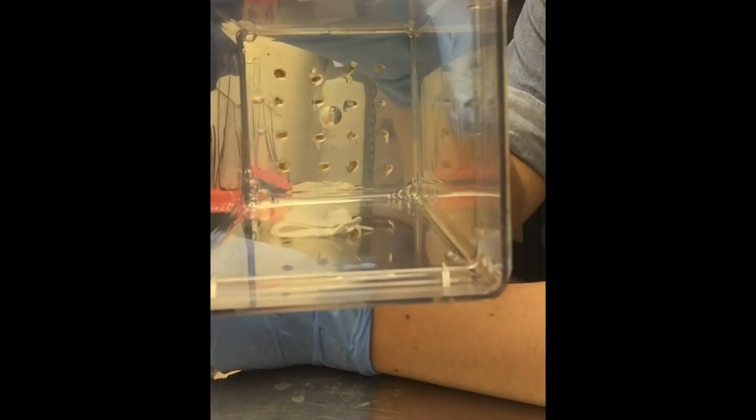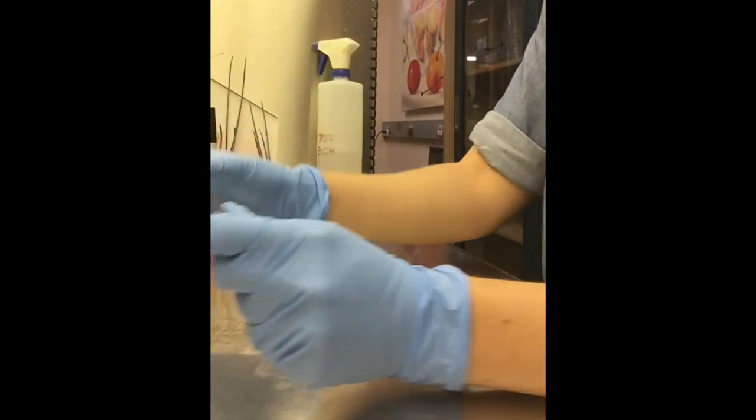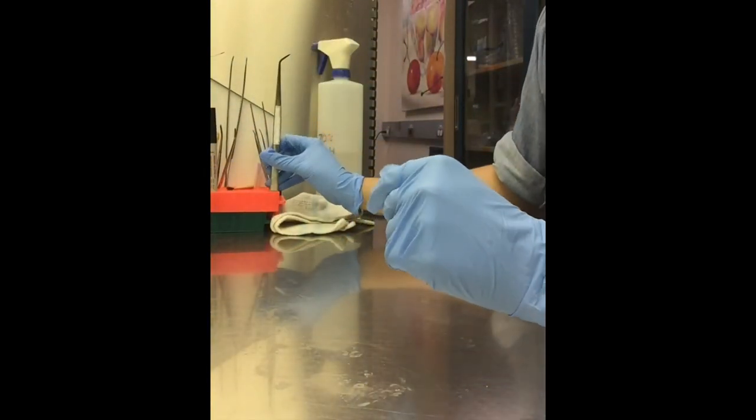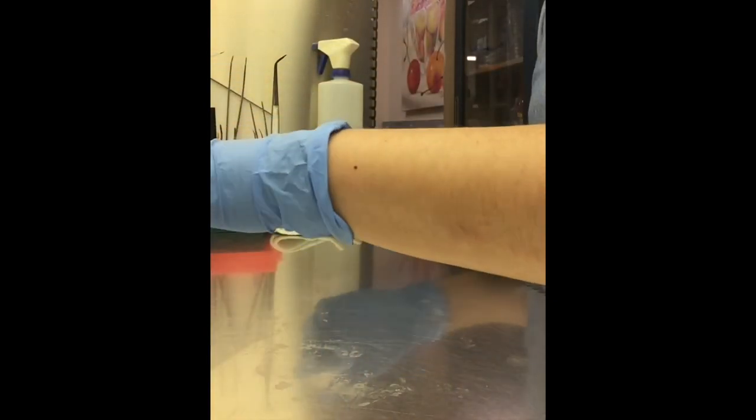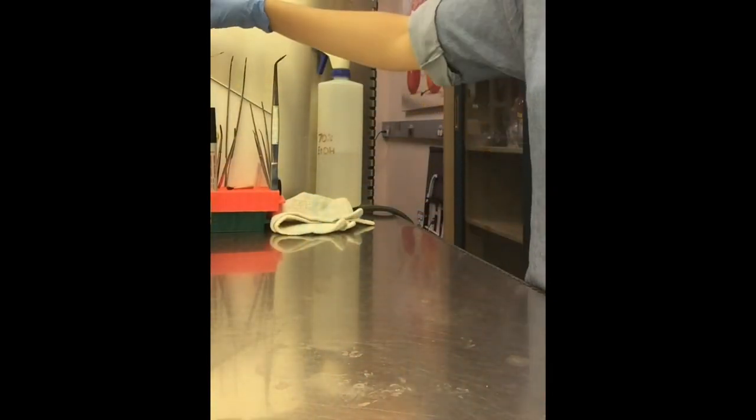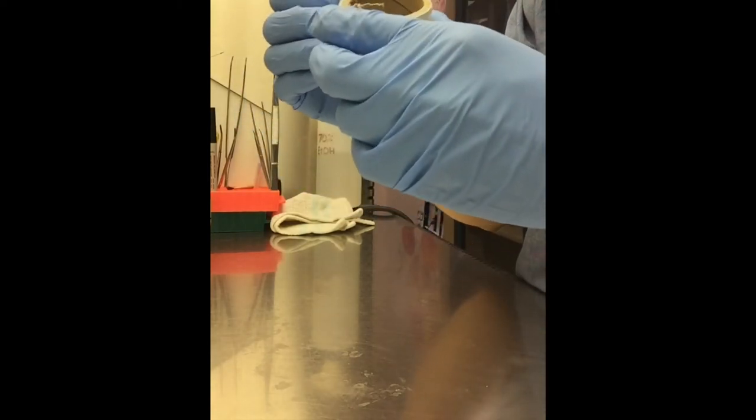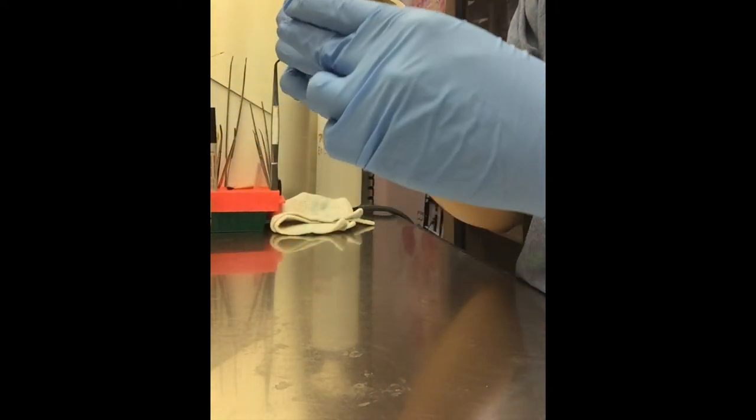Now we have a container with 16 seeds. So we're going to take it, seal them off, wrap them in our saran wrap to keep everything sterile inside.